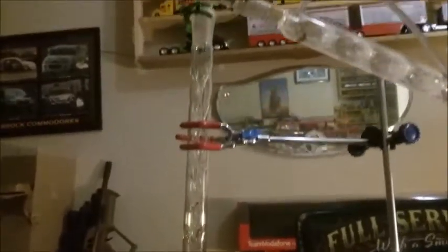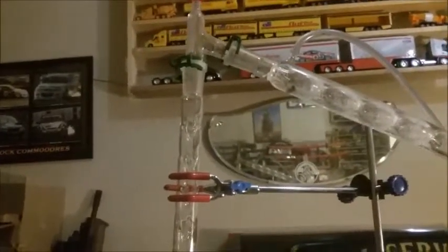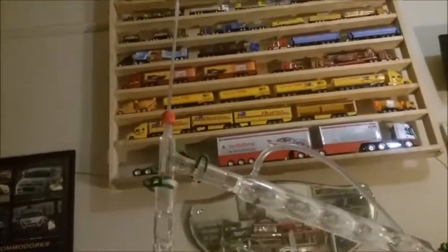With the evaporation coming up and the condensation trying to go back down, it builds up and starts to bubble in this bit just in here. So every now and again I've just got to turn it down for a moment back down to 80 degrees on here.